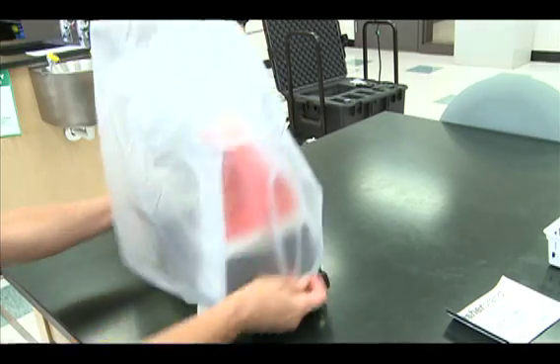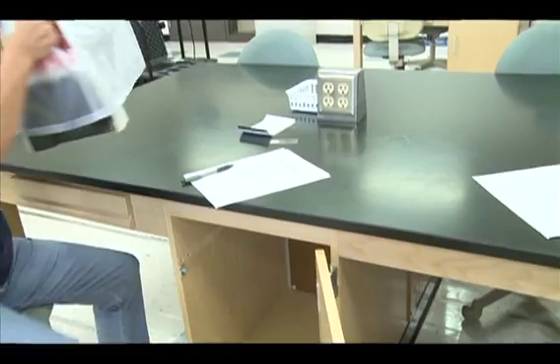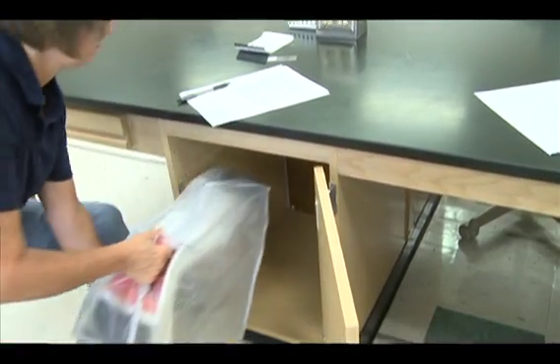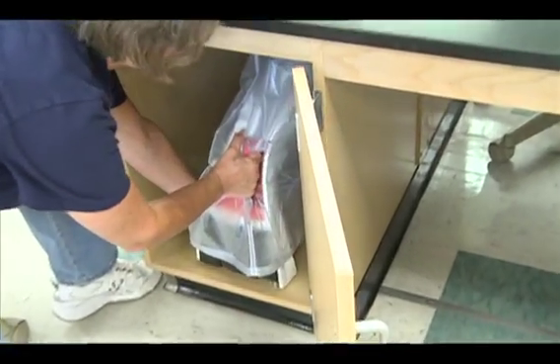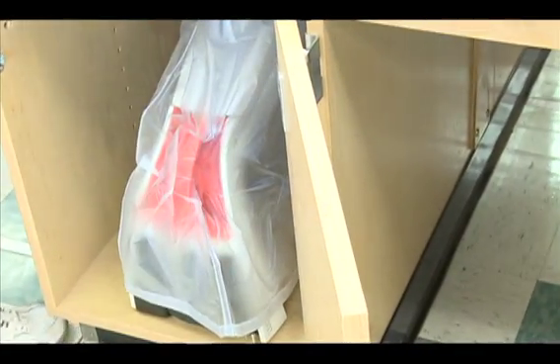Cover the scope, hold it by the arm and the base, and put it in the cabinet with the arm facing out. Be careful not to hit any microscope parts when replacing the microscope.